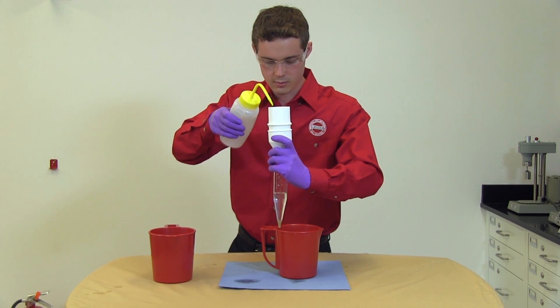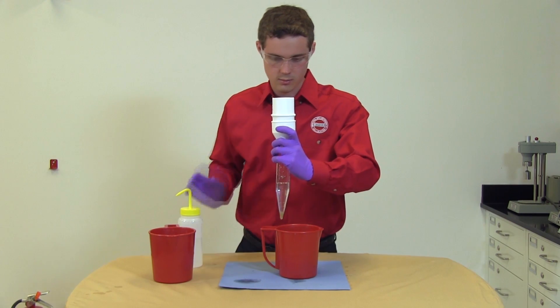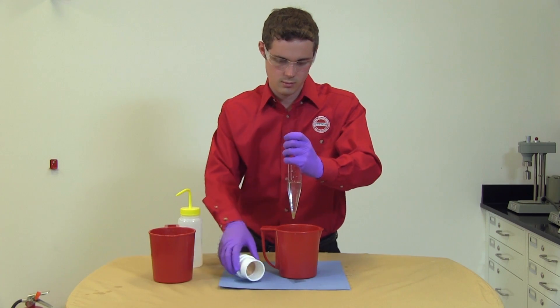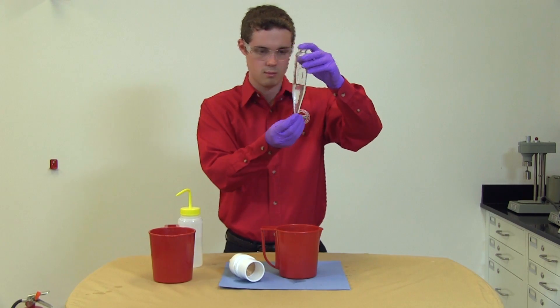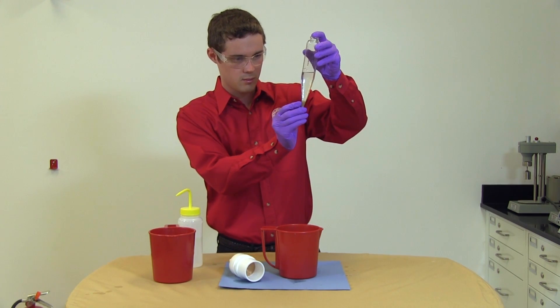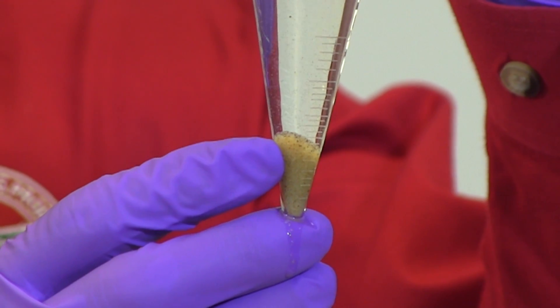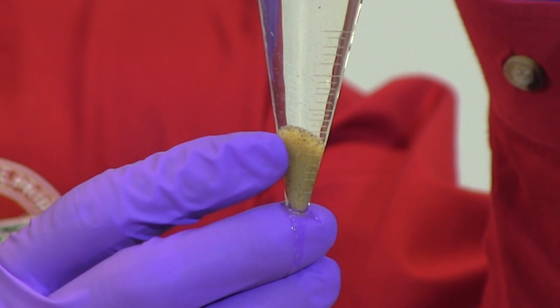Allow the sand to settle. Read the sand content from the scale on the tube, and we report this as three-quarters of one percent sand by volume in this sample of the drilling fluid.